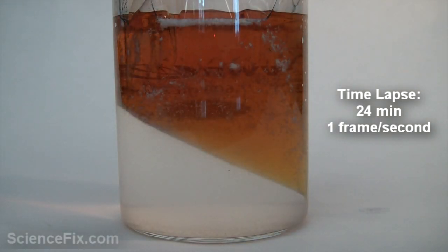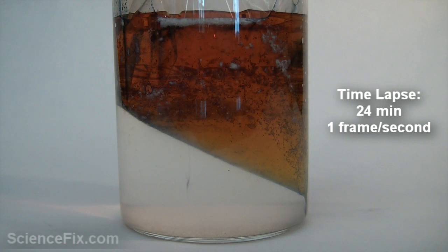The bag is now in the beaker and we see a dark bluish-purple color forming on the surface of the bag and that same color is now going into the starch water.